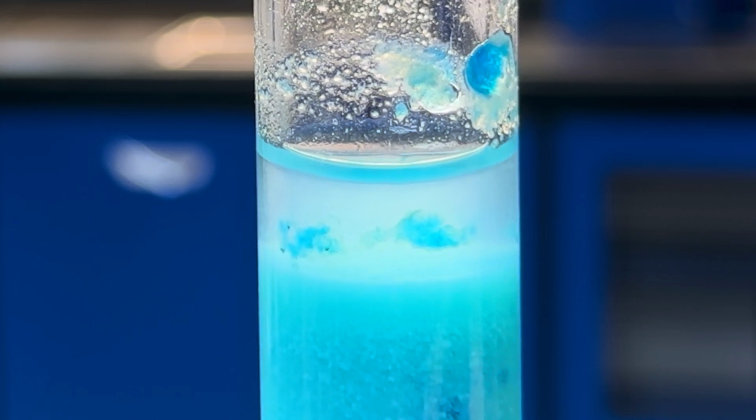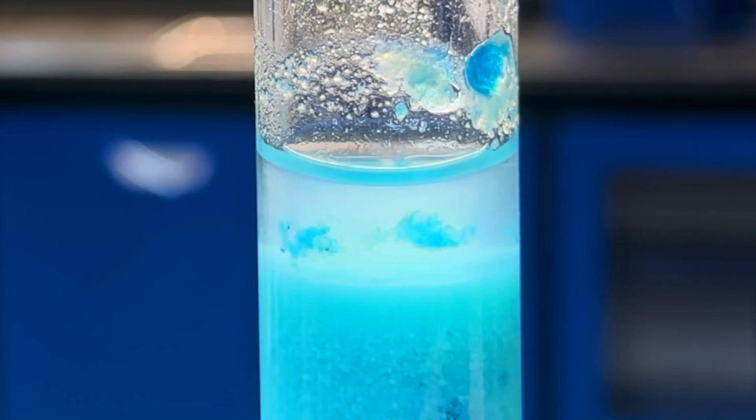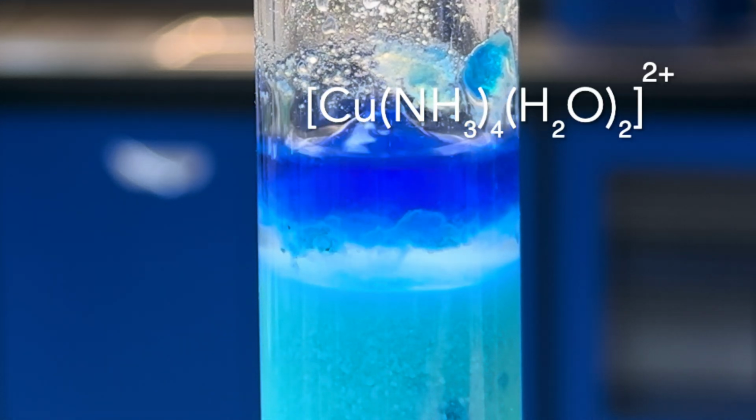Now, 4 of the ammonia molecules are actually going to participate in this ligand exchange. And what we're going to then see are 4 ammonia molecules paired up with 2 water molecules around each of the copper-2 plus ions. So you should be able to start to see a significant color change.